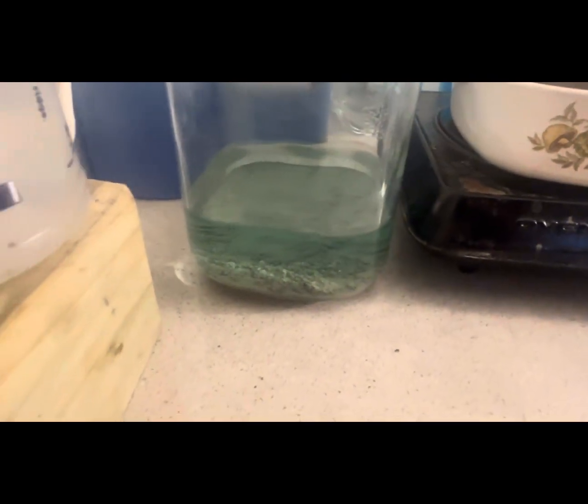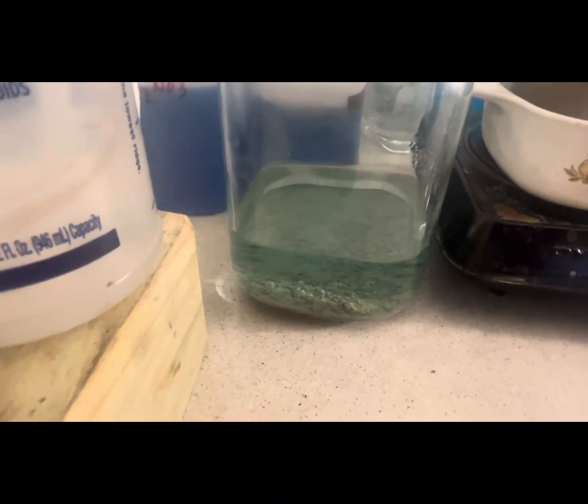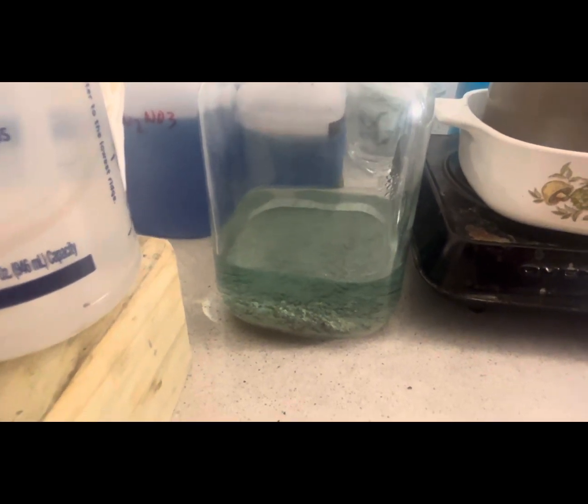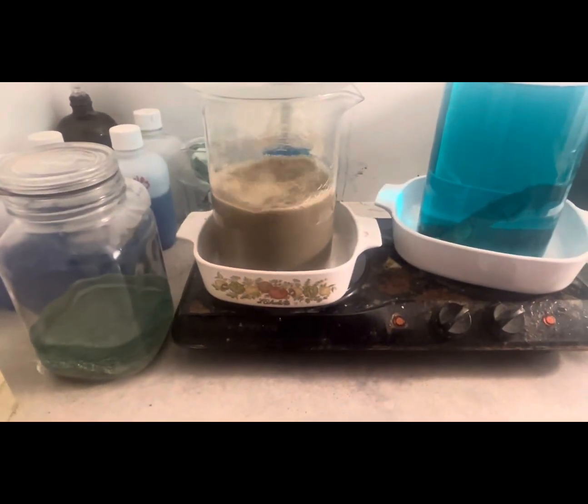This is the silver that was recovered from those fuses and that contact batch — not a bad yield. The cement weight versus the actual weight is always different when you pour the shot, so that's what we have. I've got a little update on the copper pins I put in acid peroxide — give me a second and I'll go get that.